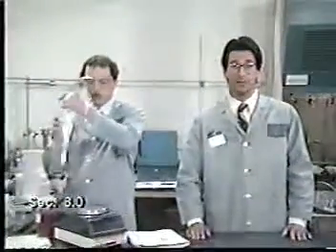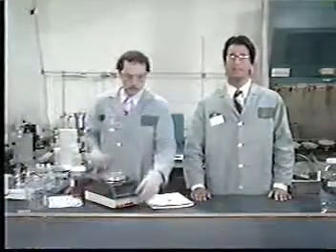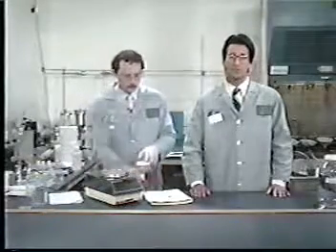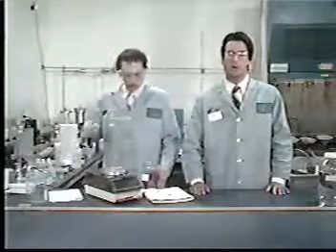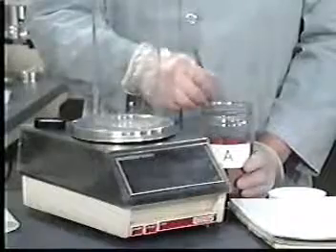We will now begin the demonstration of the bottled TCLP extraction for non-volatiles. The first step is to consider how much waste to filter. The method requires at least 100 grams, but if the waste has a low percent solids, that amount may not generate sufficient extract to perform all the necessary analysis. This is particularly a problem when the initial liquid phase is not miscible with the aqueous extract of the solid.